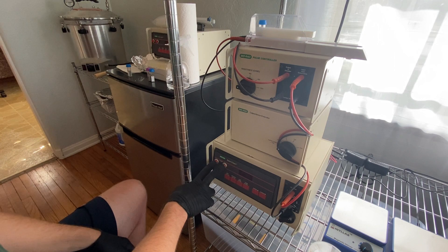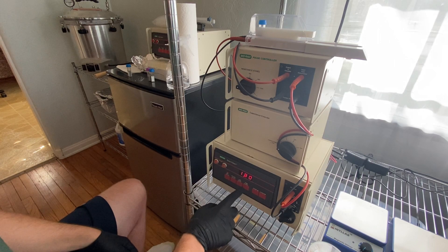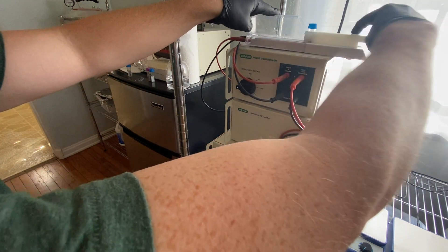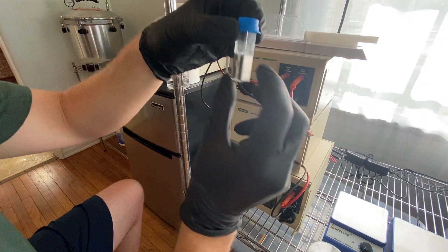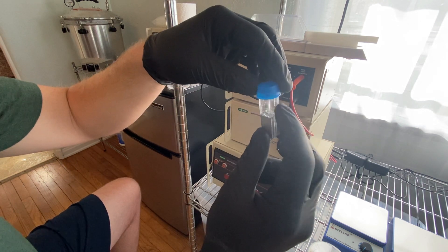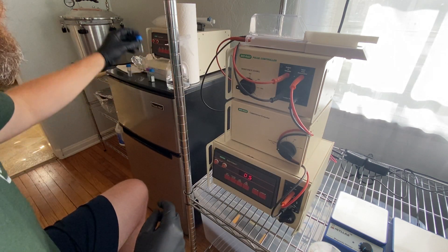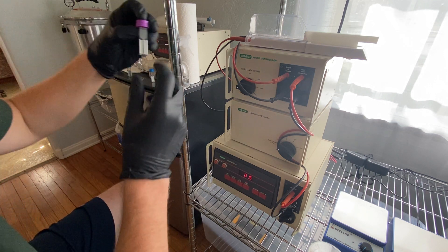That one popped — did you see that? Reading came in at 0.5 constant. Not sure what was different about that one. Looking at it, I can tell this is the cuvette that had a lot of residual burn from previous trials. I'm going to set that one aside — it may just be beyond its usable life now.